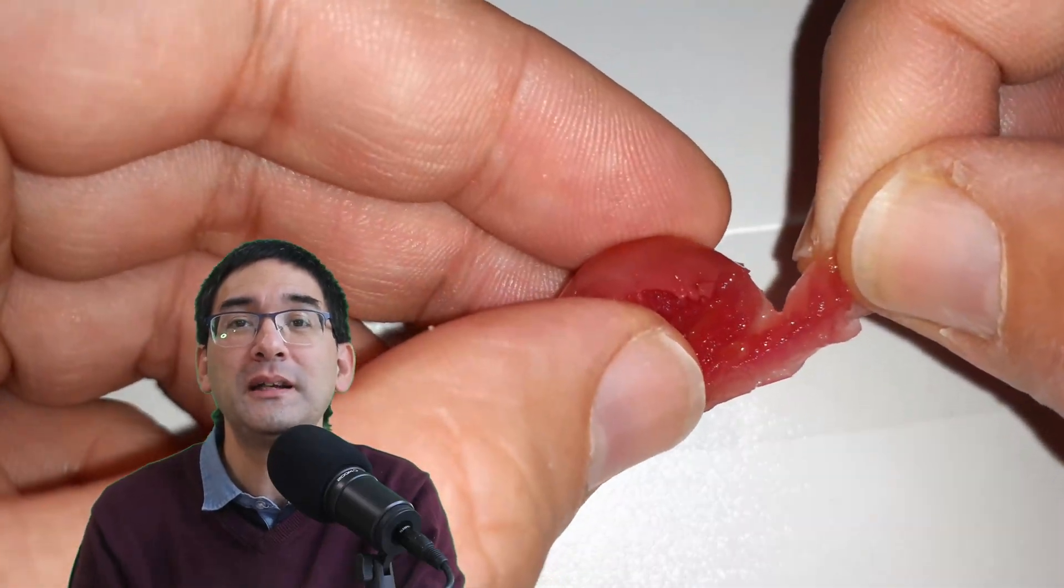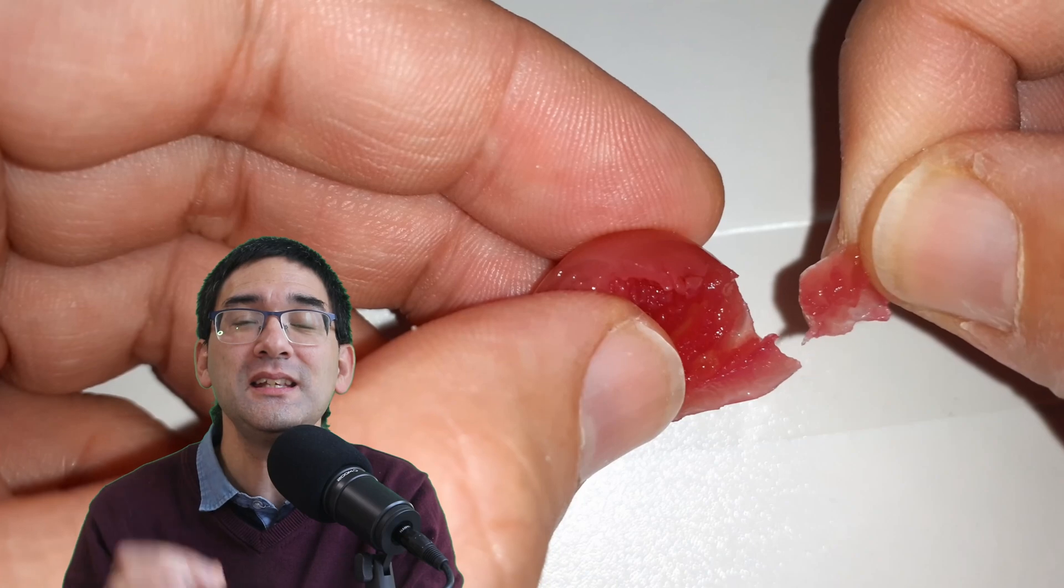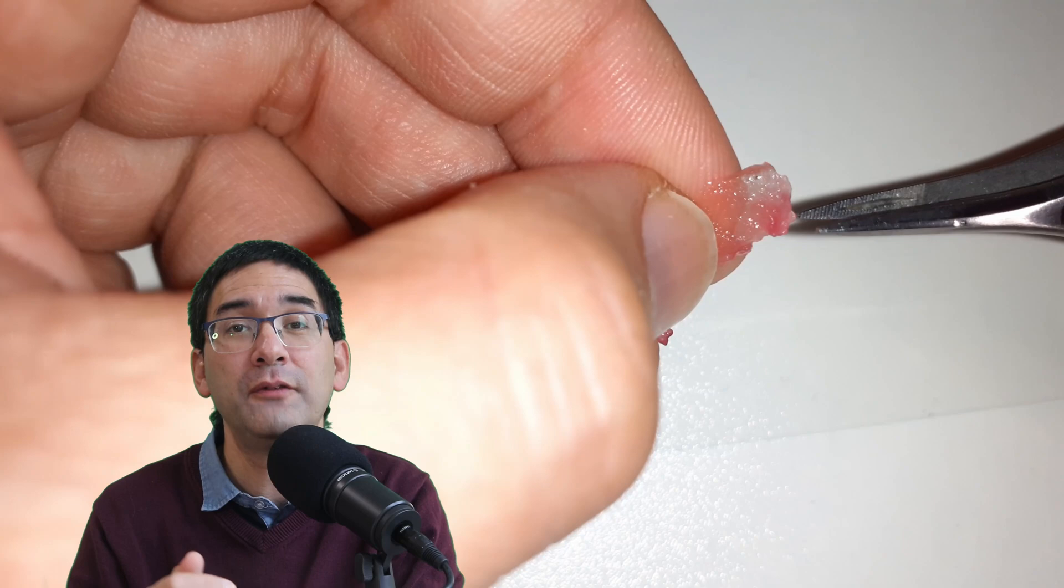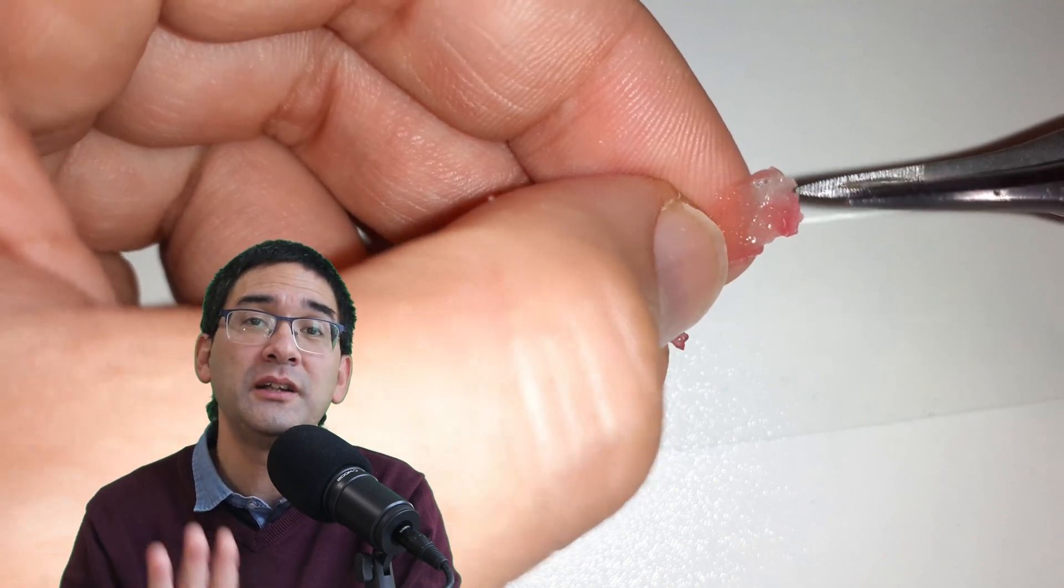I started to pick apart the cherry a little bit and was able to actually see, yes, there is indeed a skin on the surface which I could peel off very carefully. And so I have done that, and here now I did not squeeze it but I simply made a regular temporary mount with a little bit of water as a mounting medium.